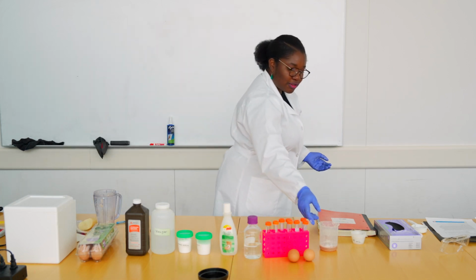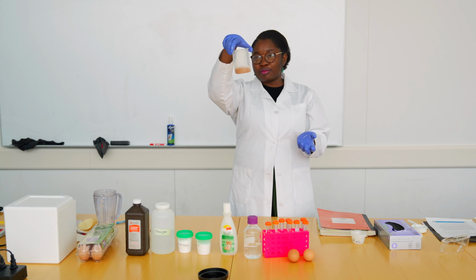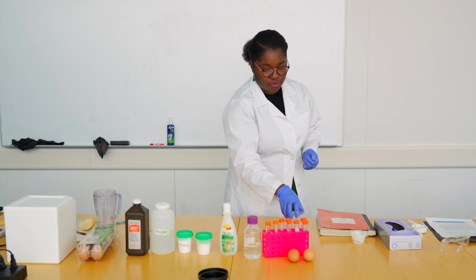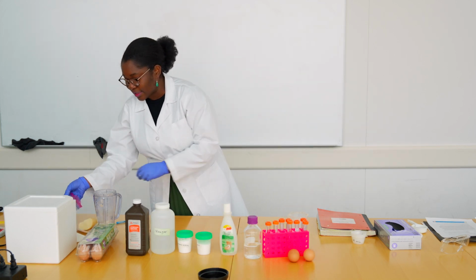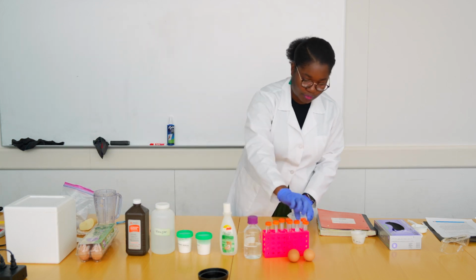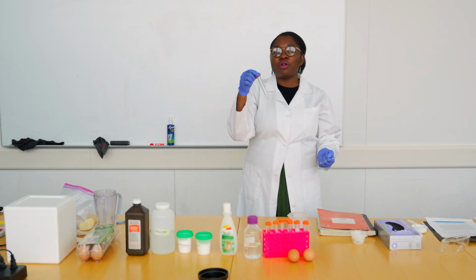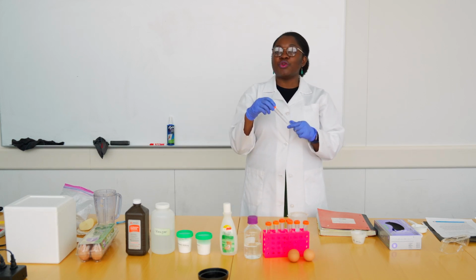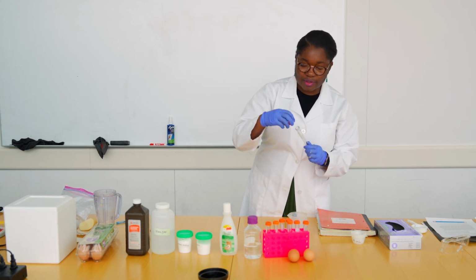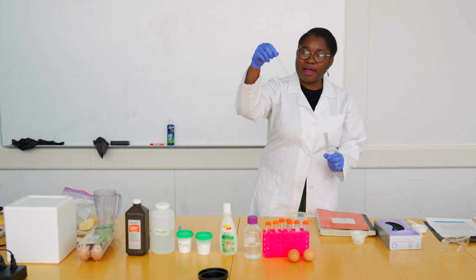So first thing you could try to observe is your components. So we have the potato juice here. It's pretty cloudy, like pretty fluid. So now you need to get your pipette and some tubes. Have a nice empty tube here. As you're working with these tubes, make sure you're always labeling the tube so you know exactly what is in what tube and you know what experiment you're doing. So we have our tube. I will label it as potato juice, and I have my pipette.